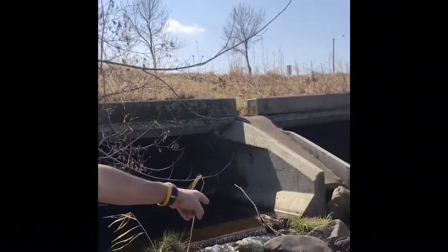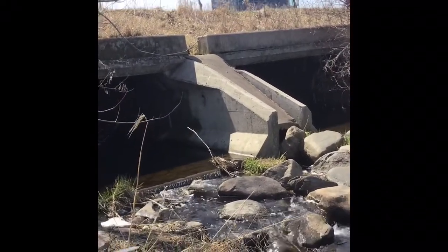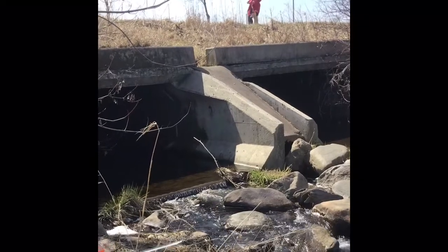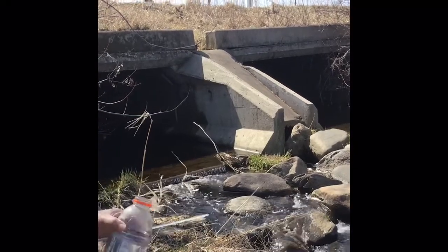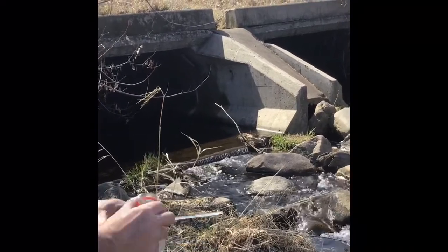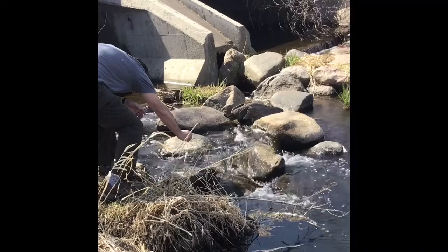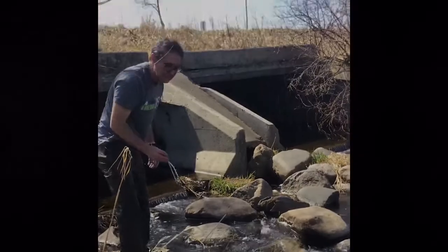But as you can see, the water flowing over the rocks is moving, and moving water tends to produce more dissolved oxygen. So I don't know if we're going to get any higher numbers than what we got before, but we'll get a sample from there and measure the DO, and then I'll get a regular water sample from here, and I'll do all the other tests that we did earlier, but not right on the site. Same temp, 15.